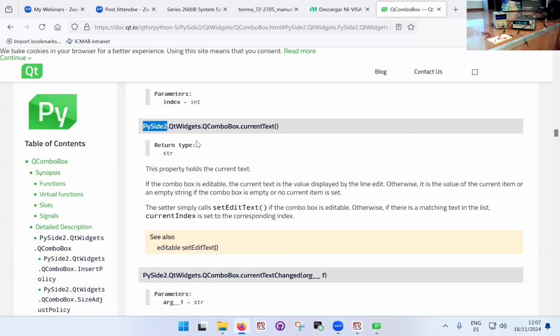Well, let's say the Qt is. There are two variants mainly that deal with this class of interfaces. One is called PySide, the other one is called PyQt. There's just sort of two different libraries that have pretty much the same commands. And what you find as PySide, just don't worry about it. It's this command. I can go deliberately to the PyQt library page, and I will probably find the same command. Anyway, it's a little detail.